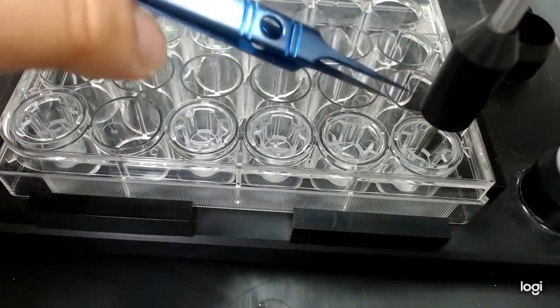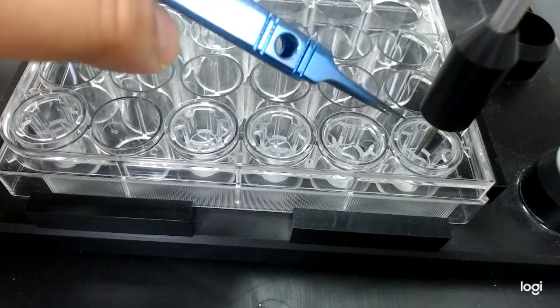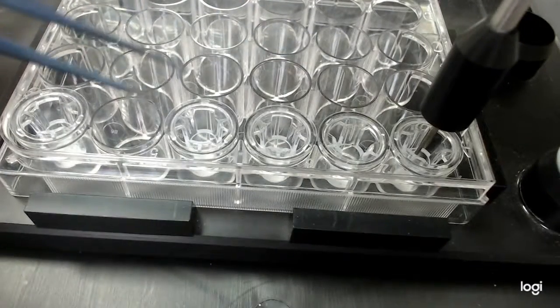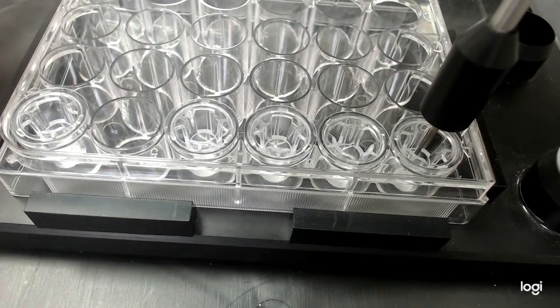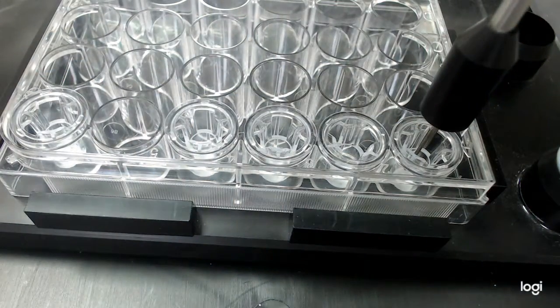So the electrode is going to come and get in through the gap. This is a C96 electrode, and this would be the suitable one in this application because it has a thinner diameter. These C96 electrodes are mainly designed for 96 well plates. Since the gap is very tight, C96 may be used.